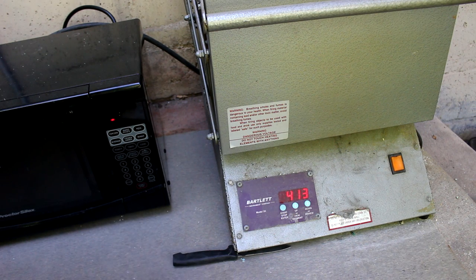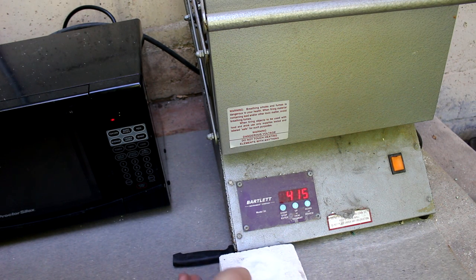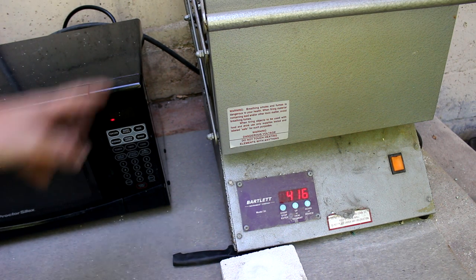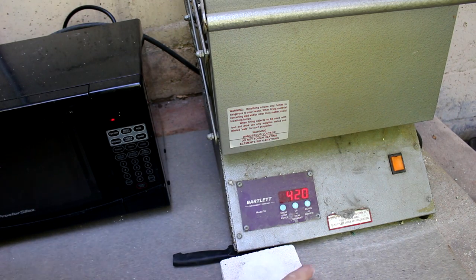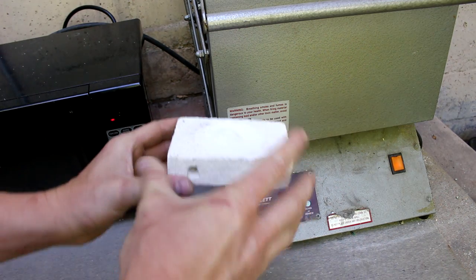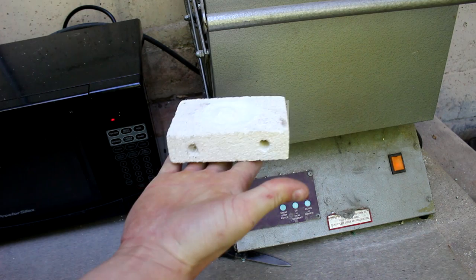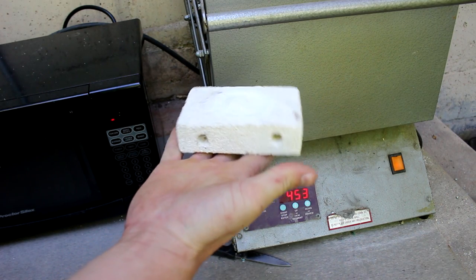So unfortunately my other furnace is still mad at me for leaving it outside in the rain. So I'm switched over to this other furnace here and also a slightly different melting dish, this alumina foam block here.